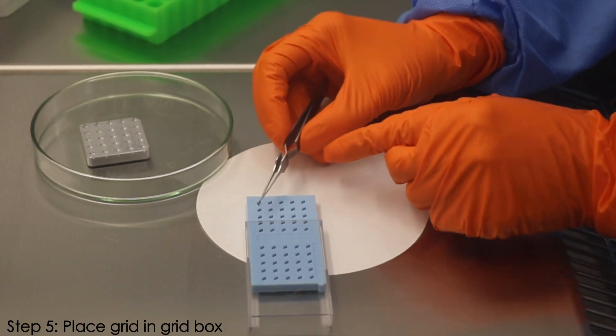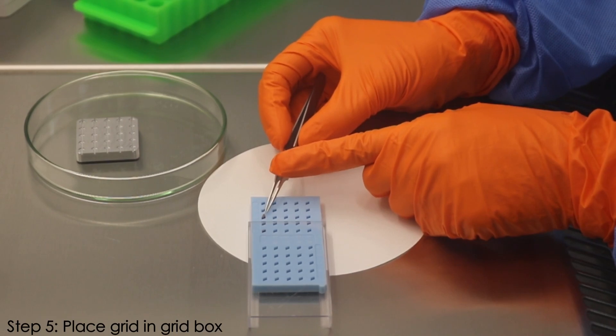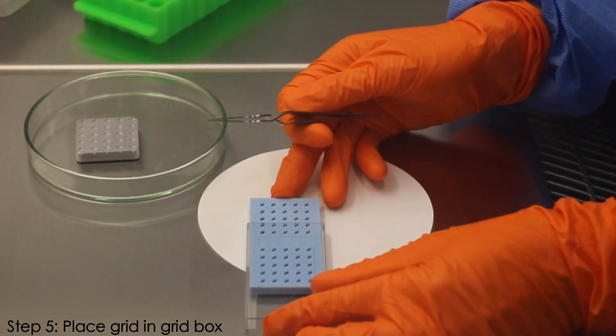If your grid appears to be sticky, this can be caused by an excess of sample. Next time, prepare the grid with less sample.